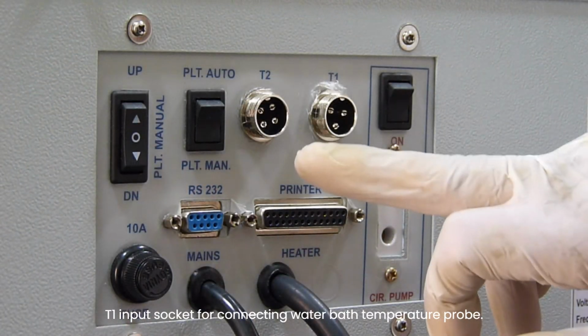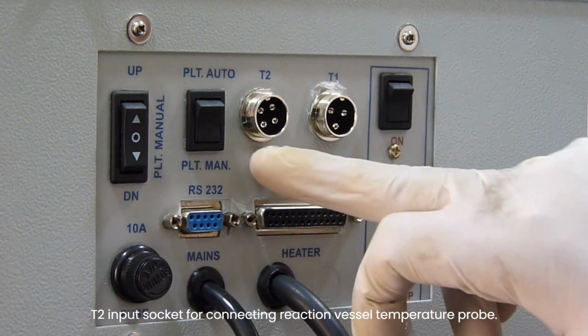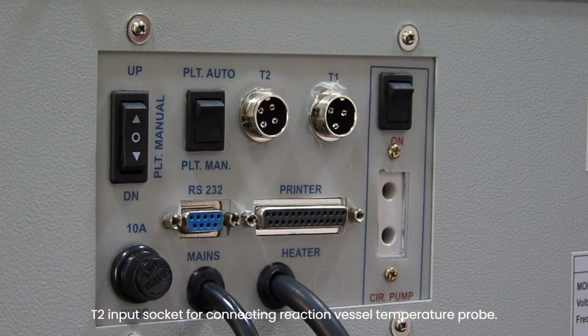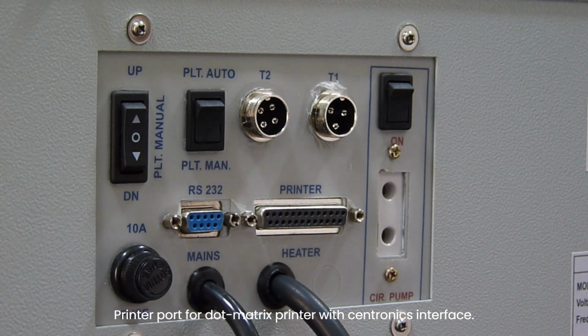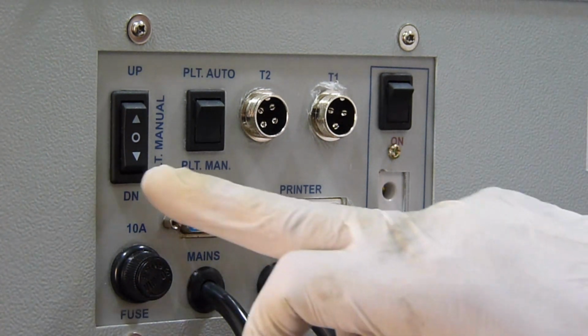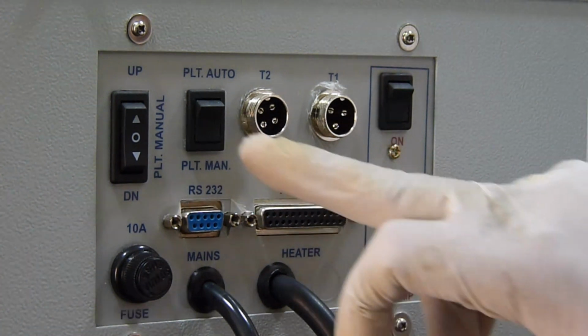T1 input socket for connecting water bath temperature probe. T2 input socket for connecting reaction vessel temperature probe. Printer port for dot matrix printer with Centronics interface. Platform up-down manual switch to move the platform up and down manually.